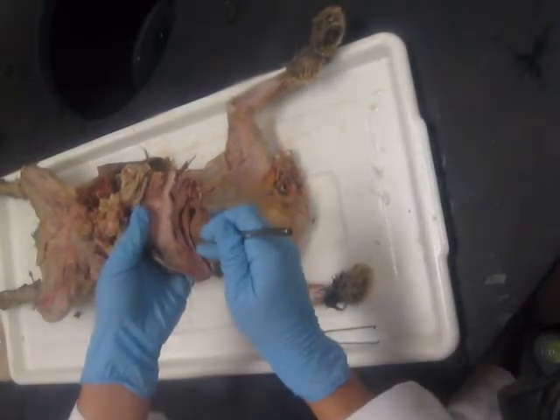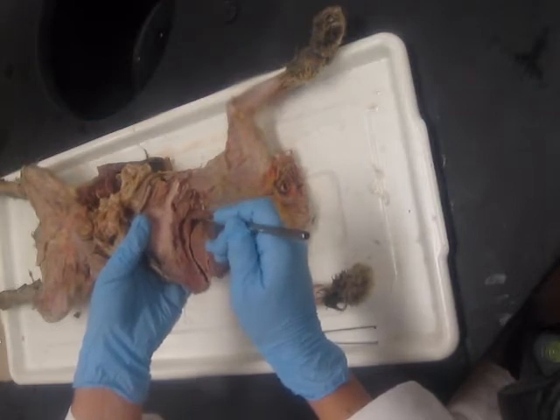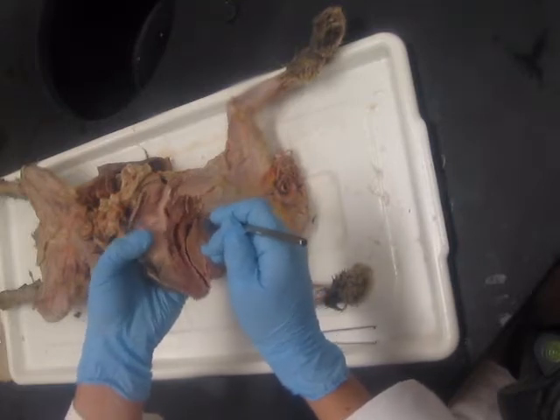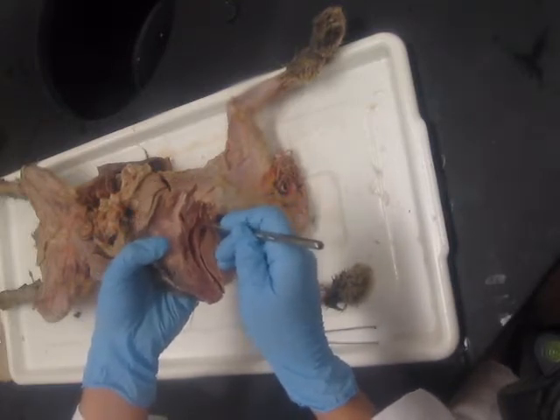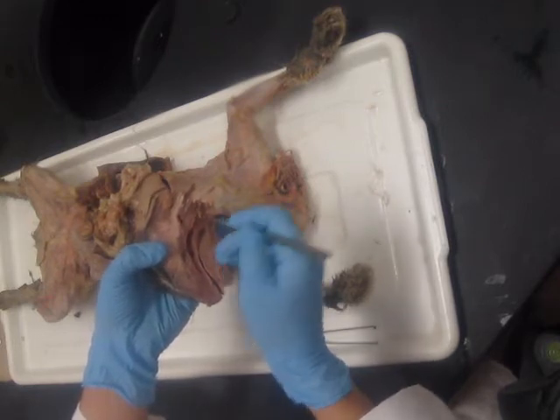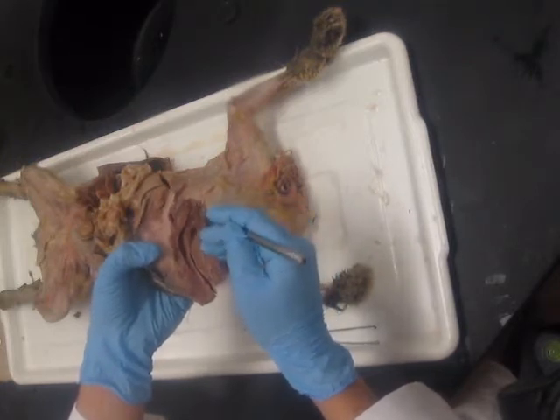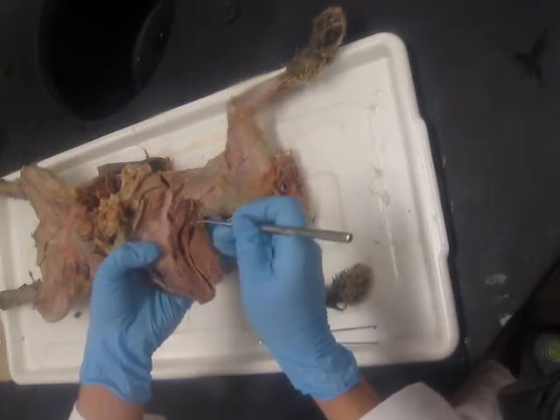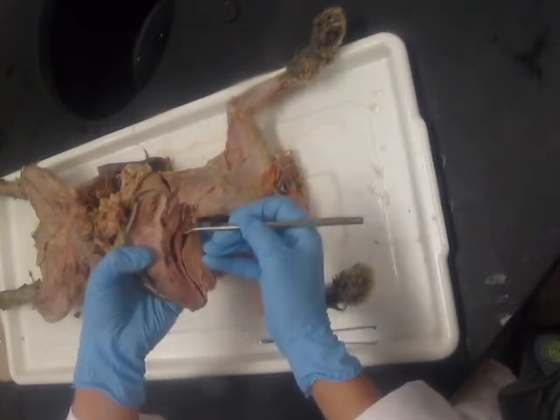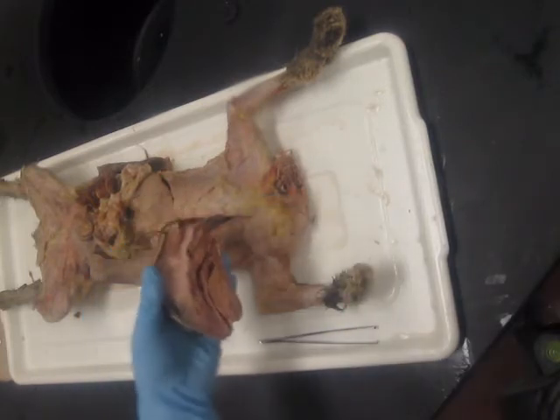Okay, so you've got oral cavity, nasal cavity, nasopharynx, oropharynx, hard palate with bone, soft palate, and then beyond the soft palate, this common area is laryngopharynx, and then anteriorly you have the larynx and trachea, posteriorly or dorsal you have the esophagus, and this cartilage piece with elastic cartilage is the epiglottis to cover the airways when we swallow.